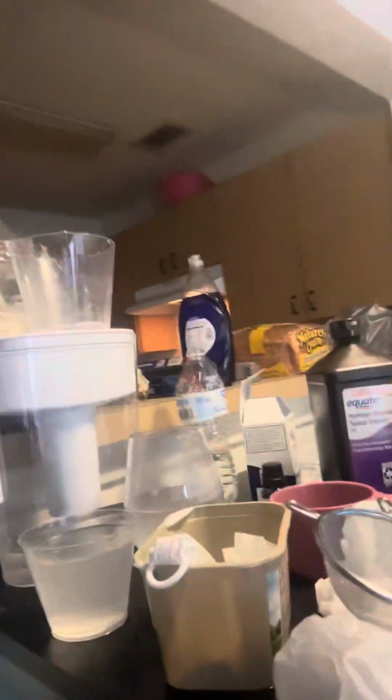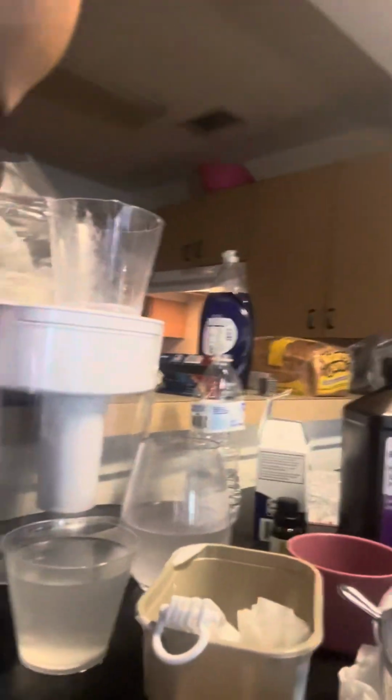I first like to disclose that this experiment did not go the way that I thought it was going to go. I did not get the results that were shown to me in the video we had via Canvas. I did try some of his tips and tricks, and I'll show you. Excuse my camera angles; I'm working off of my phone and I can't flip the camera. So this is my whole setup area over here.